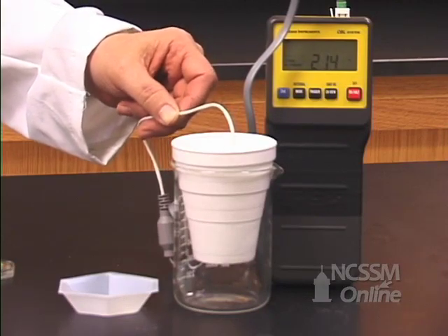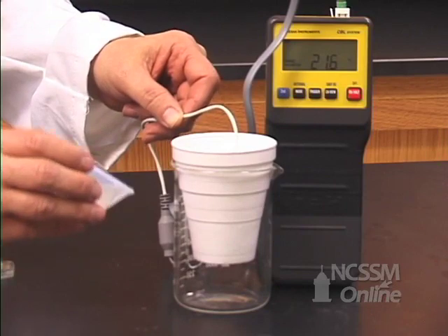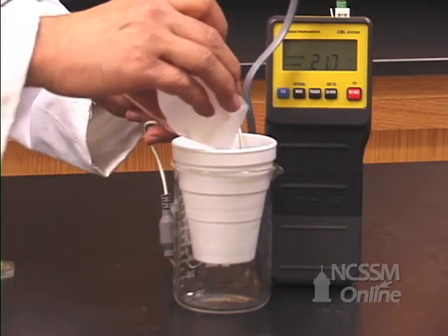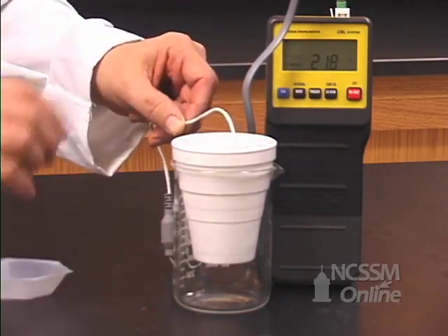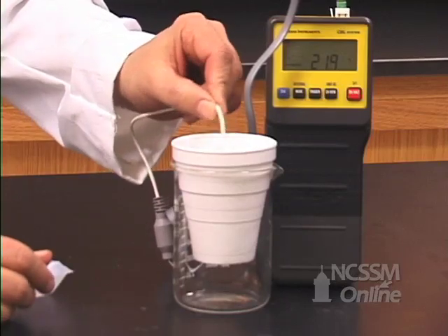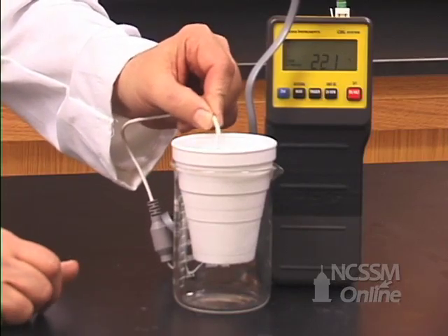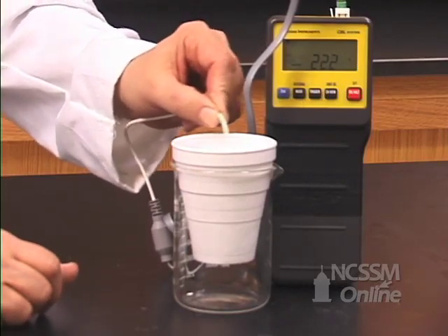When the temperature reading has stabilized, you will then add the sodium hydroxide. You will stir the mixture and record the highest temperature reached.